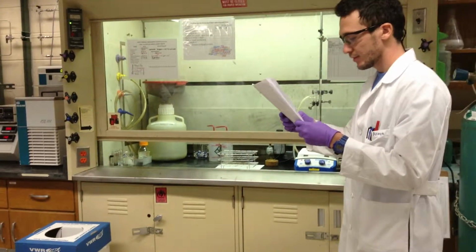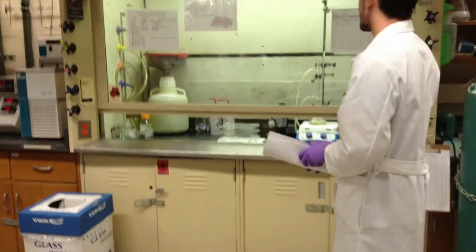And that is about it about this chemical waste.